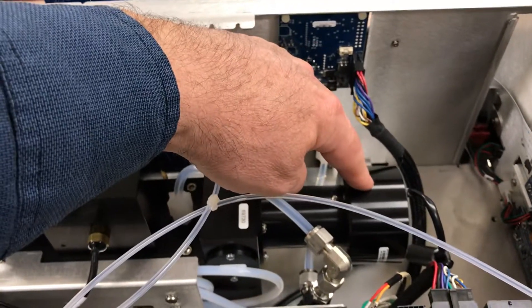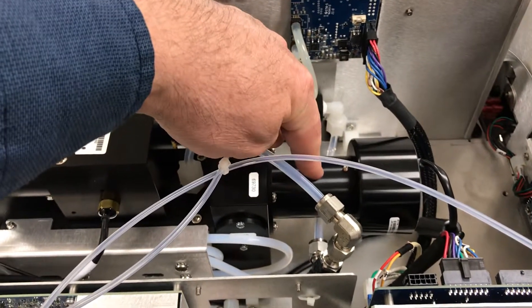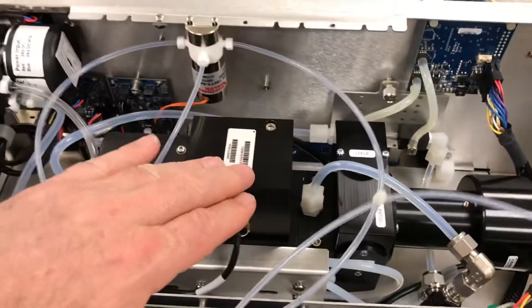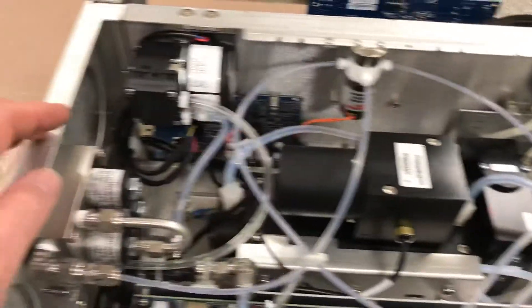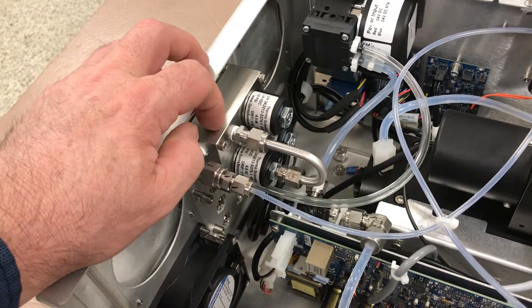The lamp socket is on the front side of the analyzer with the lamp just inside the tube. There's a mirror assembly, PMT housing, PMT socket, and a zero/span solenoid option in this one, again with this heavy-duty block.